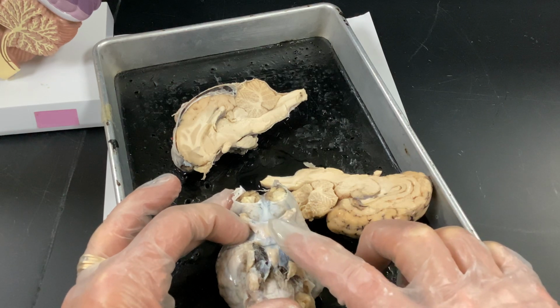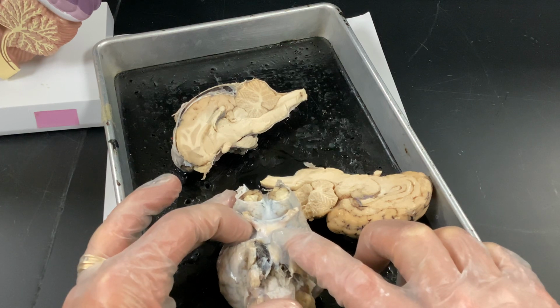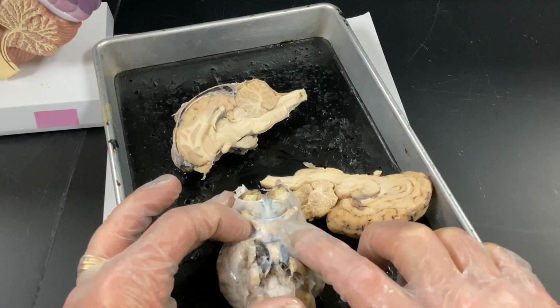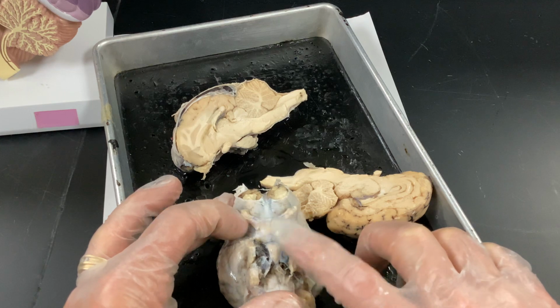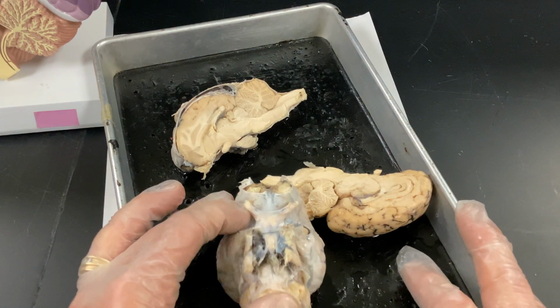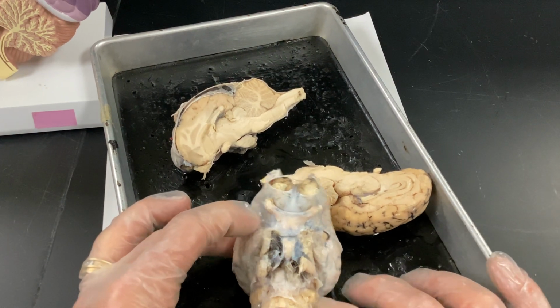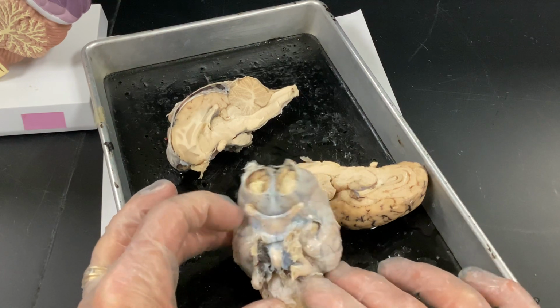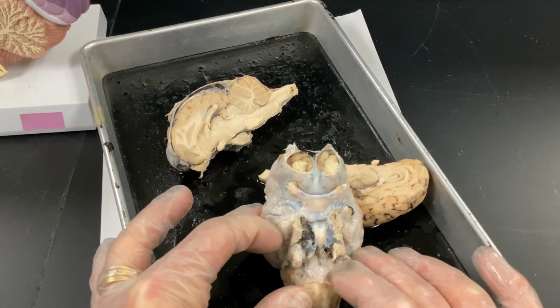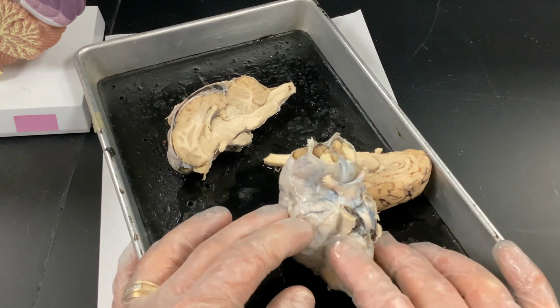The pituitary gland is right here. It's going to be hanging off the infundibulum. And if you have a pituitary adenoma, if it gets really, really large, it can start compressing the optic chiasm, and you can start losing part of your visual field, and you won't know because your brain will literally fill in that image. So it's very important that you all get routine eye exams occasionally so we can check the visual field. And so I'm just going to sort of roll it over.